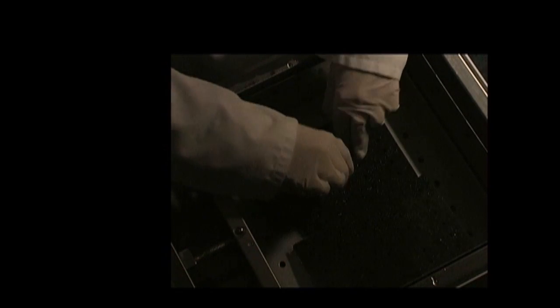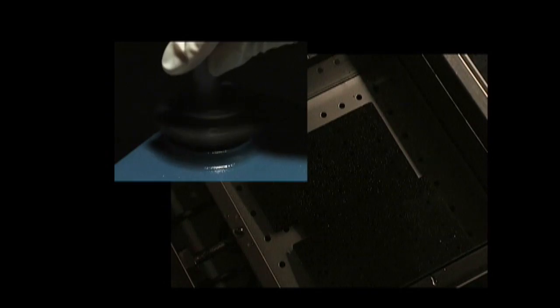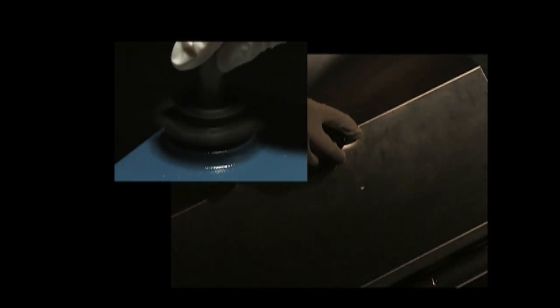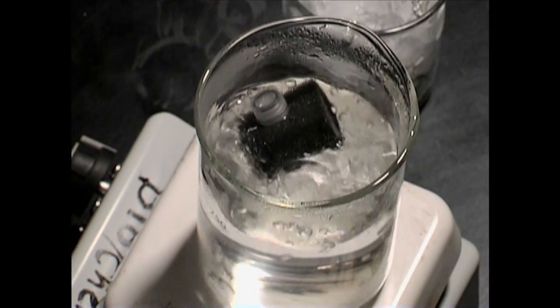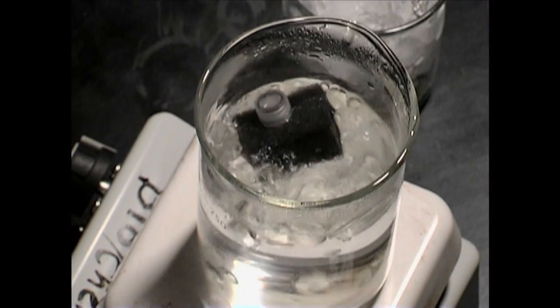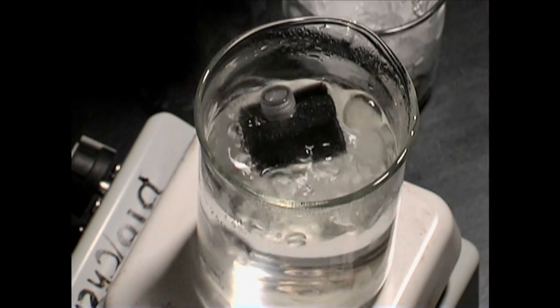Heat the tube in a 56 degree water bath for 15 minutes. Remove it, let it cool for 30 seconds, and vortex it. Place the tube in a float and boil it for 10 minutes. This will break down the cells, but leave the DNA intact.